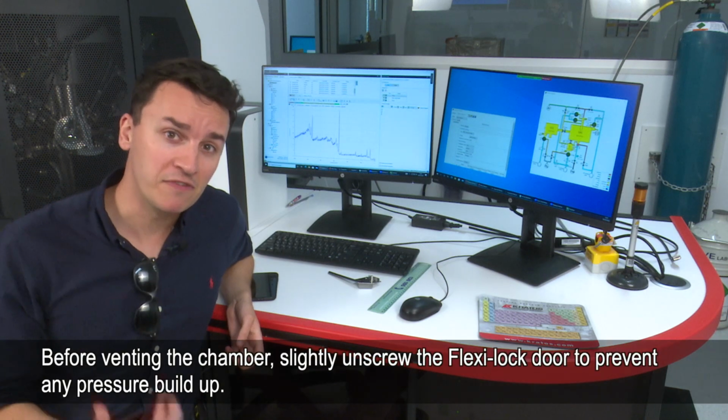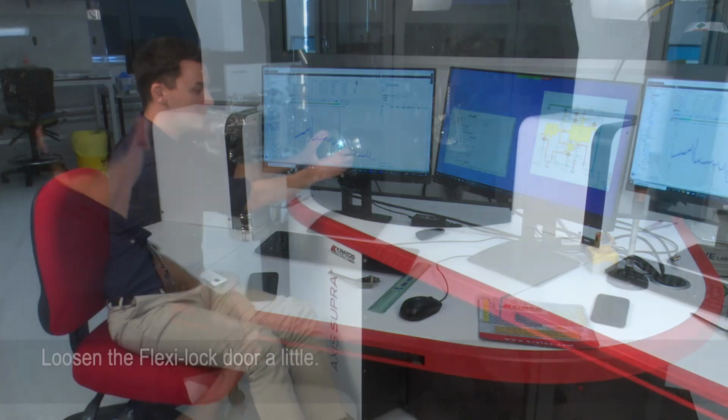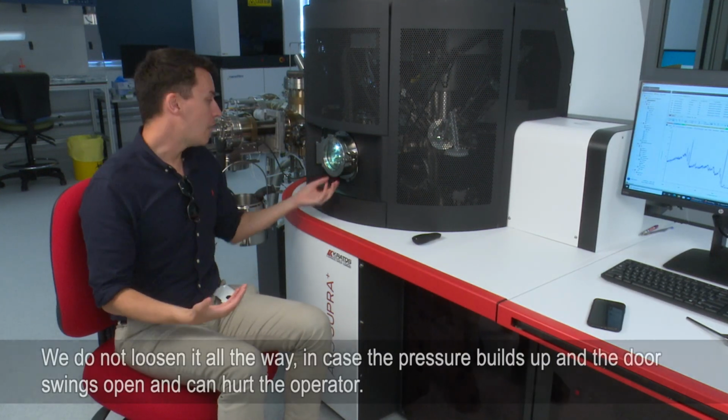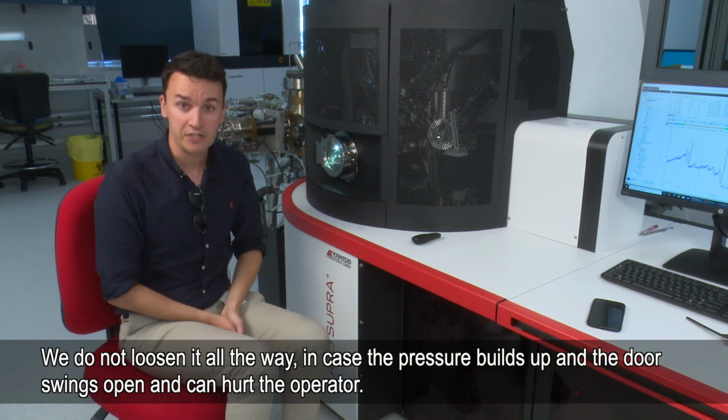Before you vent the chamber, you've just got to slightly unscrew the Flexilock door just to prevent any pressure build-up. Loosen it a little bit. That way when the pressure builds up, it won't damage the instrument. And we don't pull this off all the way, just in case the pressure is a little bit higher. We don't want the door to swing open and hurt us.